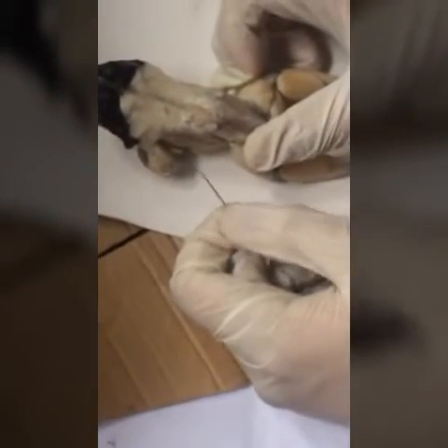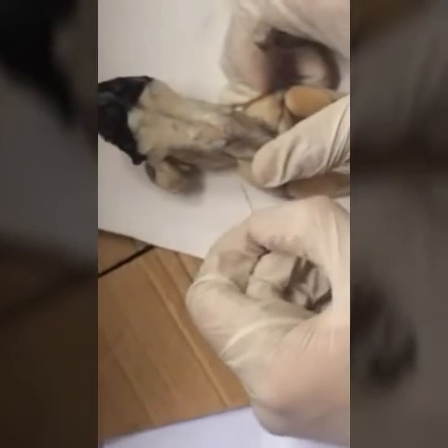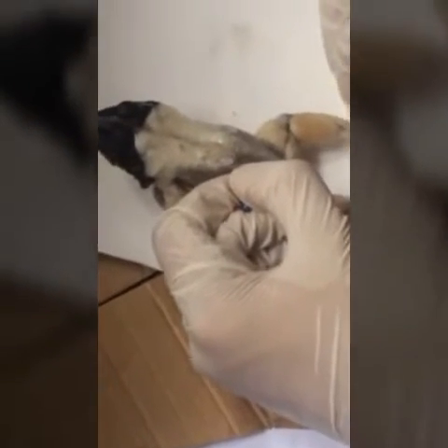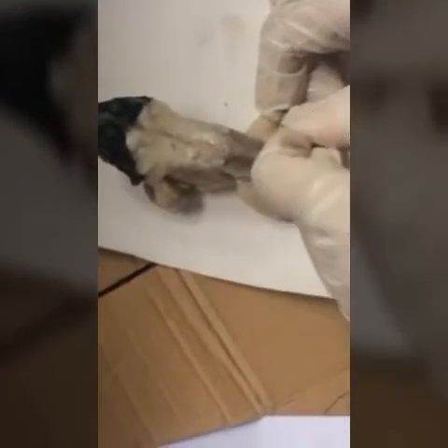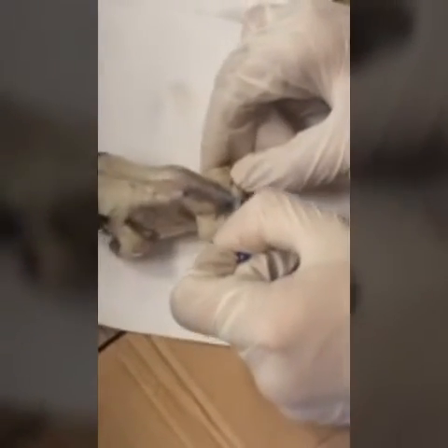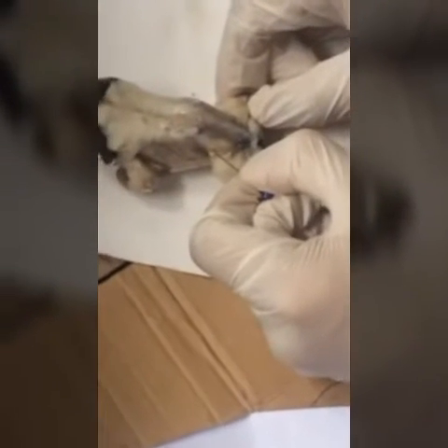Then you can see the coccygeo iliacus here. Then you can see the gluteus — the butt — here, on the other side of the frog. Then you can see the vastus externus here.